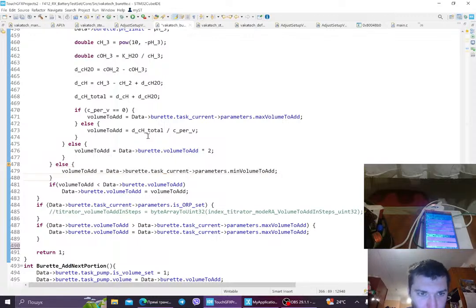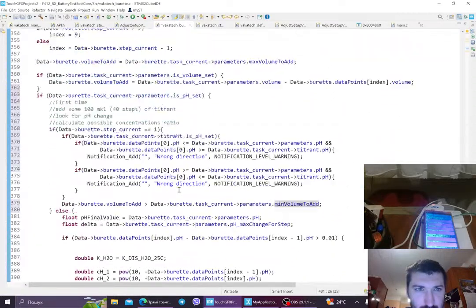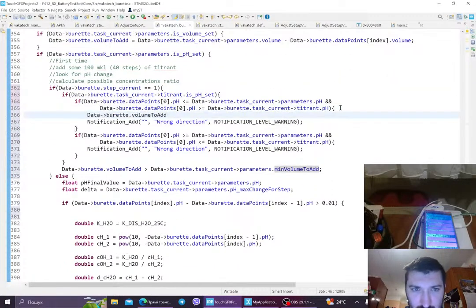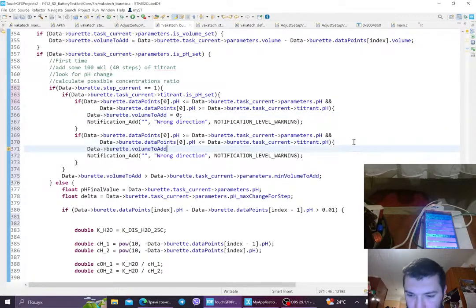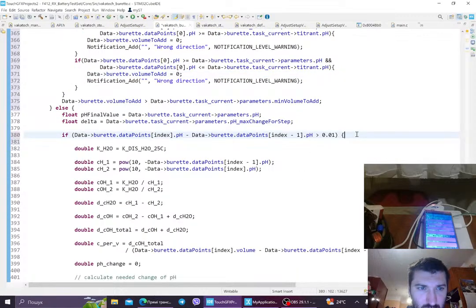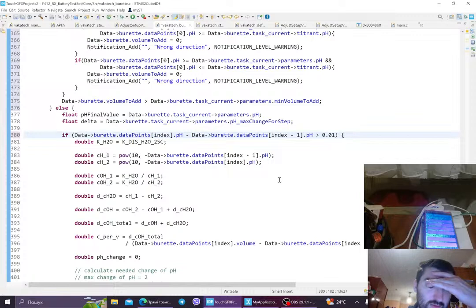And I probably want to pause. I don't know. Hard code here. Hard code here. 0, 0. Nice. And then we have here.